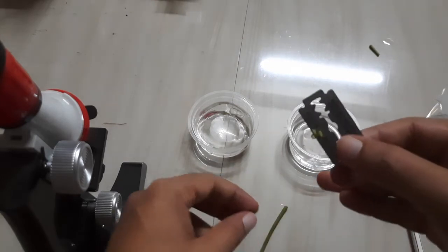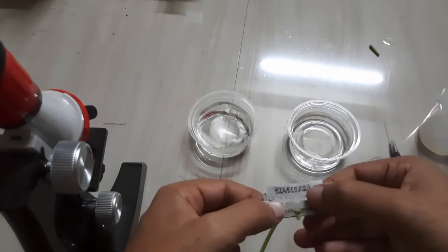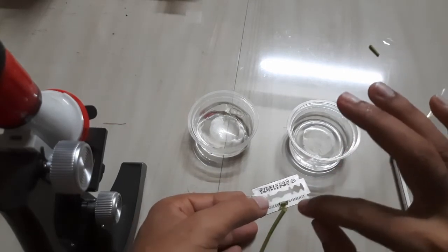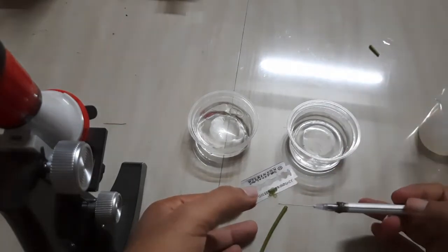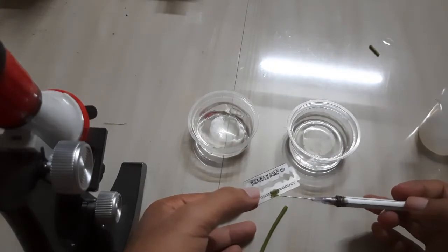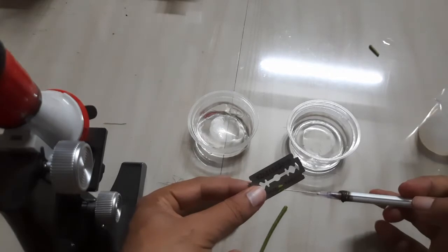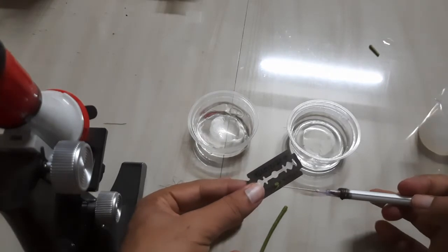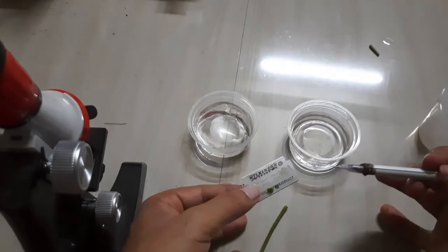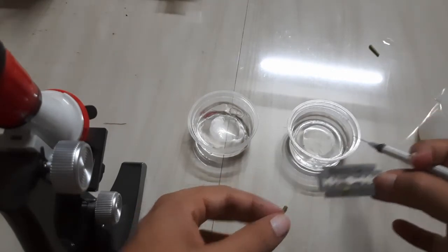I have prepared a lot of TS sections. Among these TS sections, I have to take whichever is the thinnest. Why? Because through the thinnest section only, light can pass.